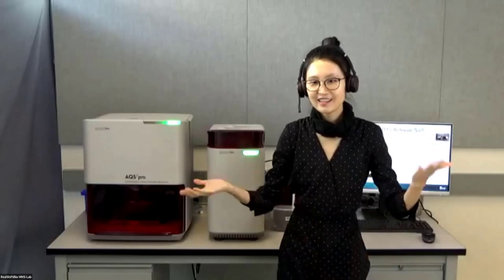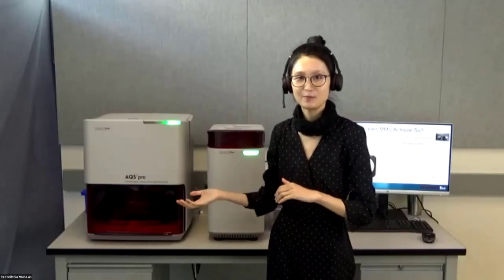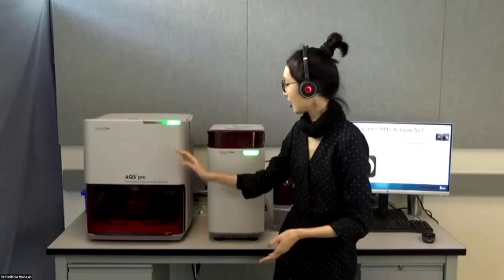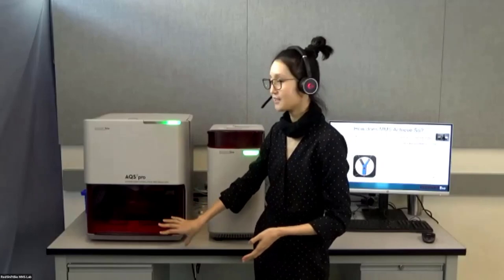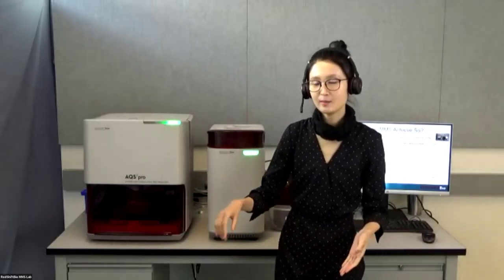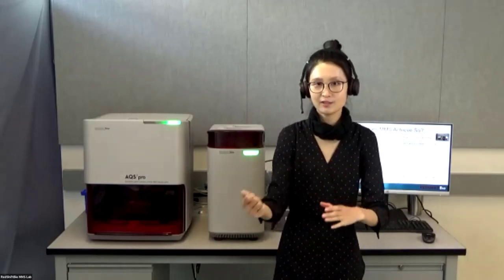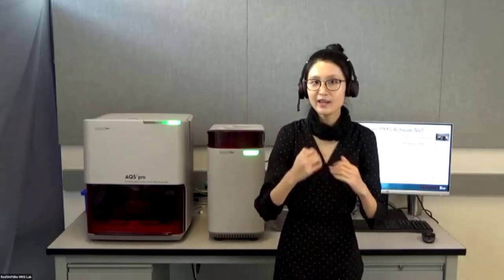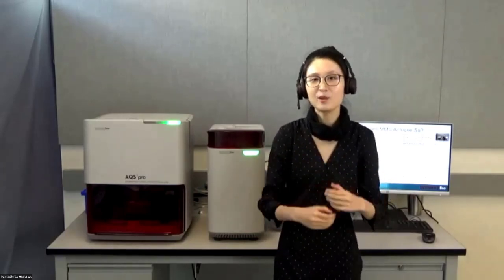That's pretty much all the sample prep. This is the only thing that needs an extra person to do, just to load the sample and to put it inside the instrument. For 96 well plate, sometimes it's confusing to load all the samples. So we have a really nice sample loading guide to help you do that correctly.